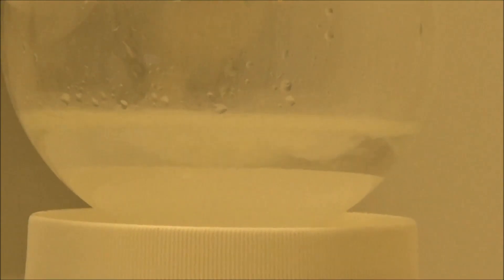Here we can see the first good sign of our desired product. The distillate separated into two layers, the lower one being organic.